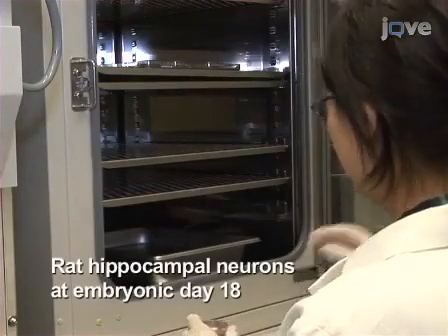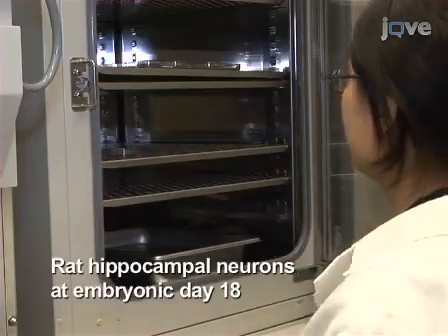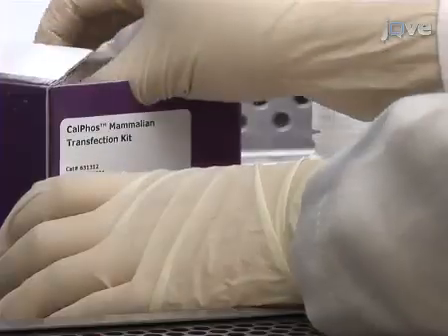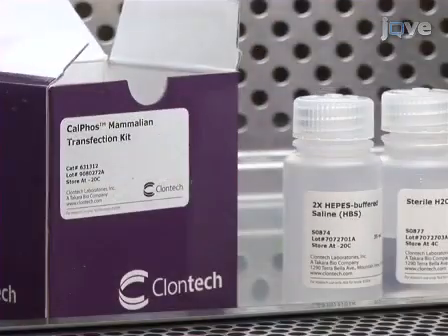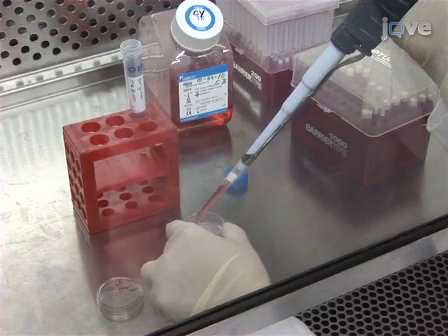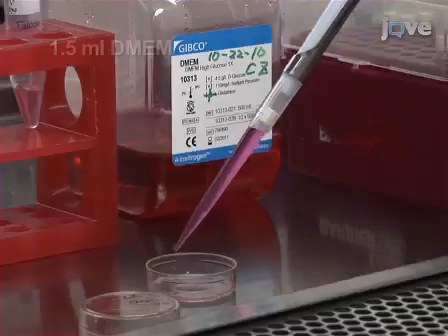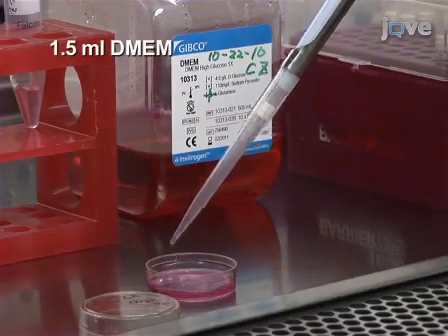Begin this procedure by culturing embryonic day 18 rat hippocampal neurons on poly-D-lysine-coated MatTek 35mm glass bottom dishes. On 16 to 18 days in vitro, transfect neurons using the Clontech CalPhos mammalian transfection kit. Before beginning the transfection, save the original culture medium in a sterile 15ml tube for later use. Fill each 35mm dish with 1.5 ml of Dulbecco's modified Eagle medium 30 minutes prior to transfection.